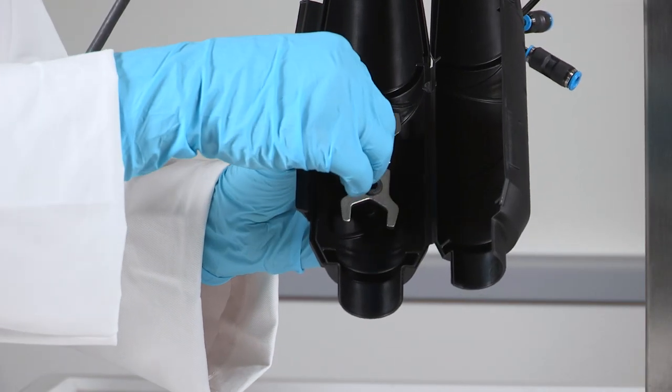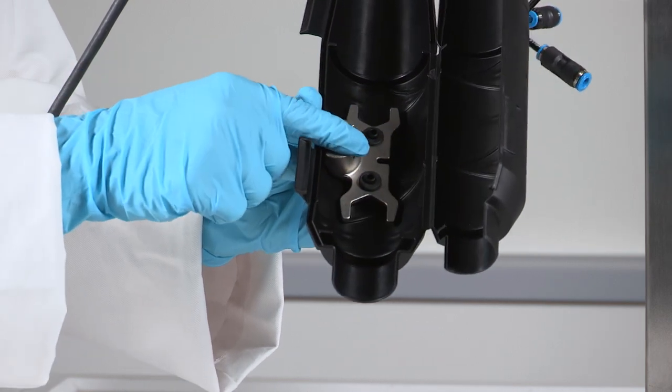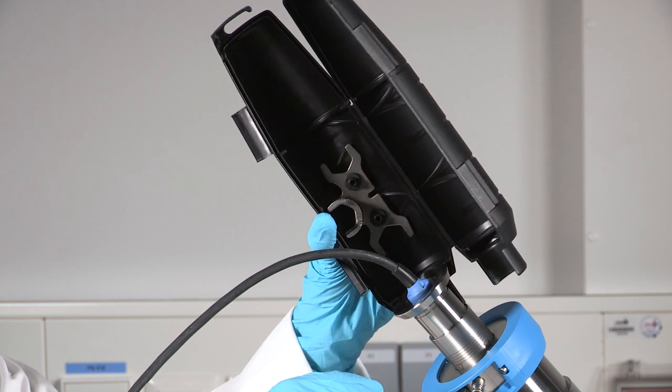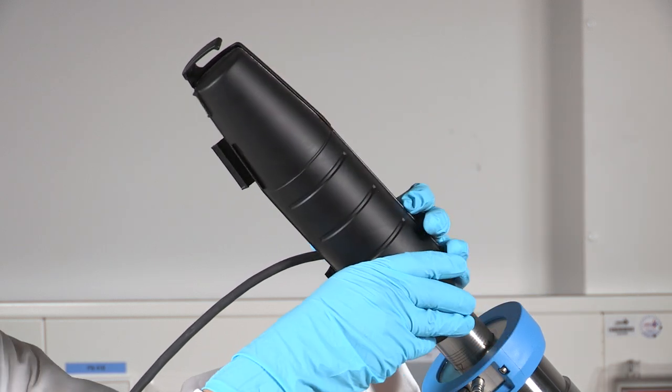Reattach the open-ended wrench back into the protective cover. Mount the cover while guiding the measuring cable through the cable run at the top of the protective cover.